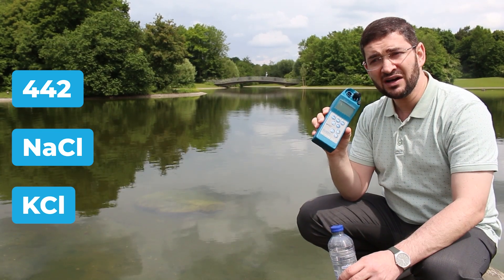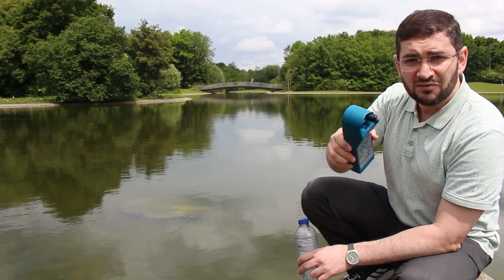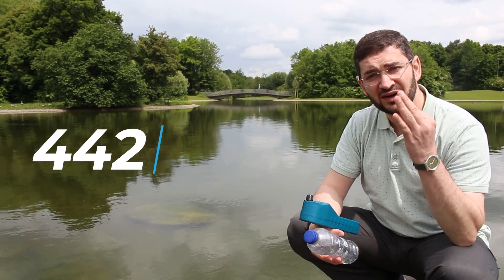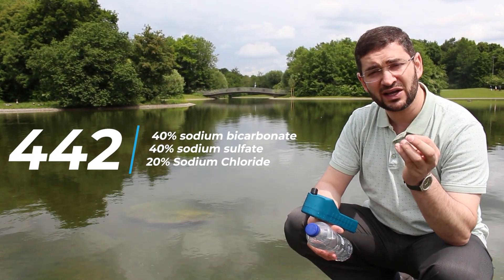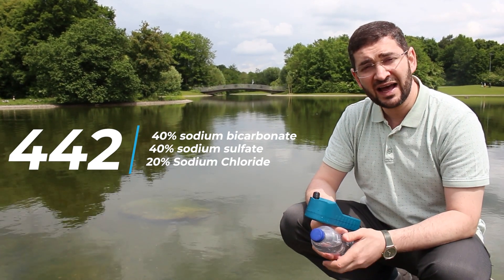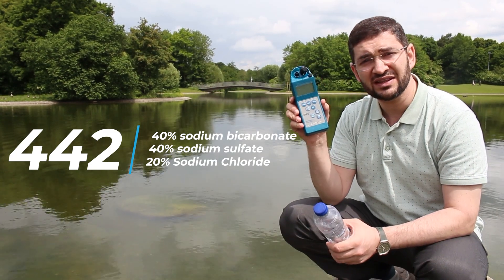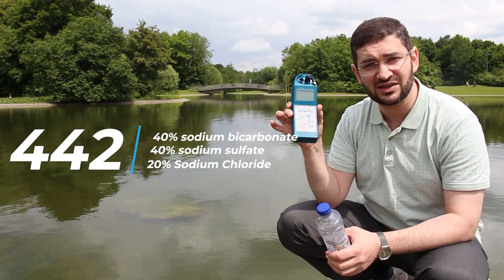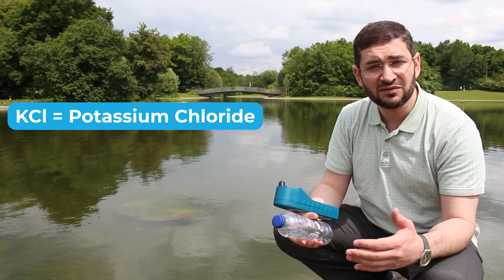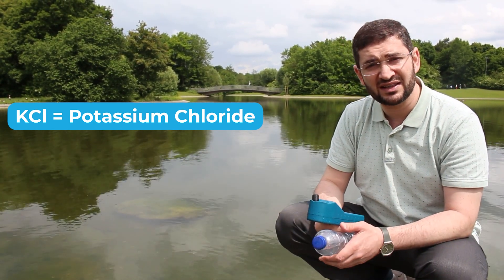Keep in mind that each of these three measuring options has its own application. For example, 442 stands for three components: 40% sodium bicarbonate, 40% sodium sulfate, and 20% NaCl, to represent conductivity and TDS. KCL is used mainly for calibration purposes of conductivity meters and TDS meters.